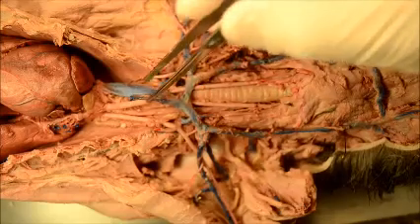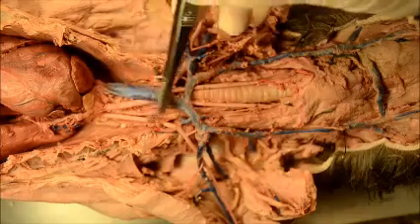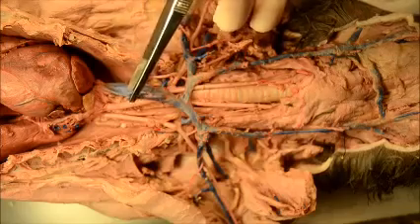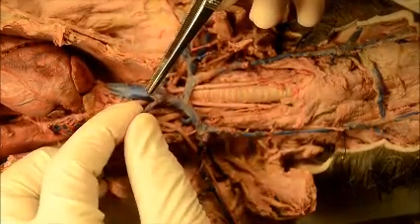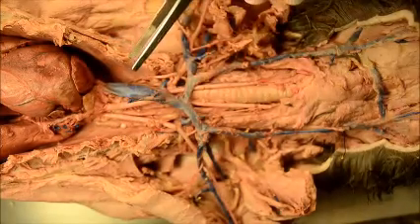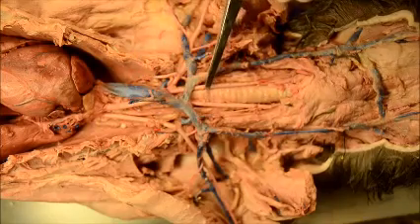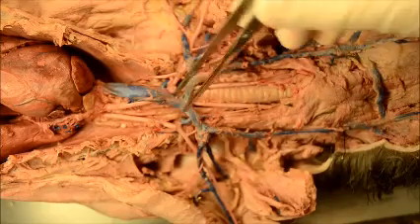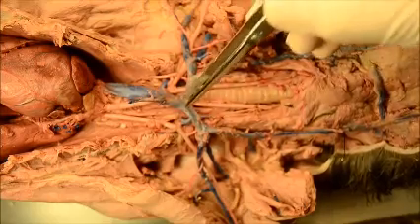If there's only one vessel, you wouldn't have to indicate left or right. There's only one superior vena cava, which is here. And then you have the internal mammary, which comes out of it here. If you look at that division — that bifurcation — that's how blood is drained from the left and right part of the chest wall. So unlike the artery, there's only one. As we continue, it bifurcates — it divides into that Y shape that you see here.